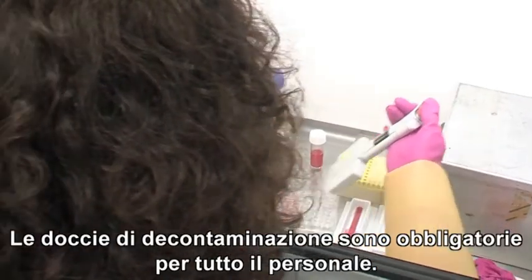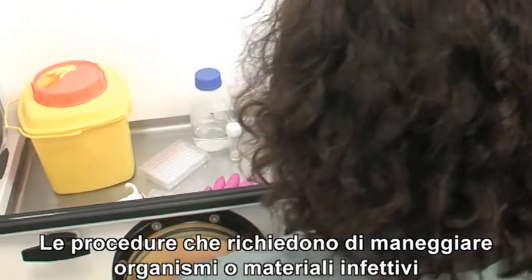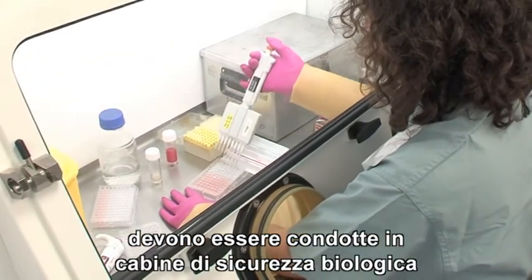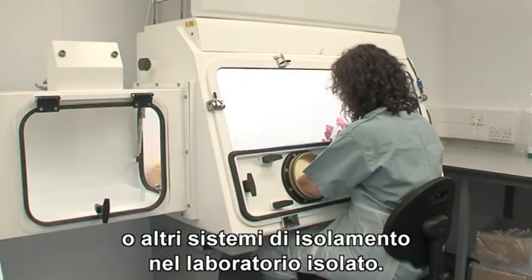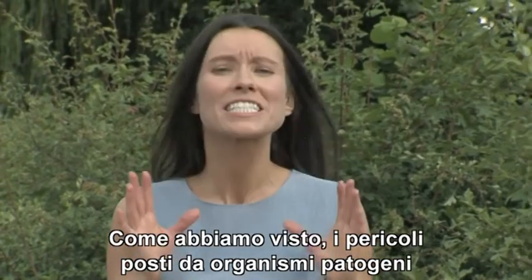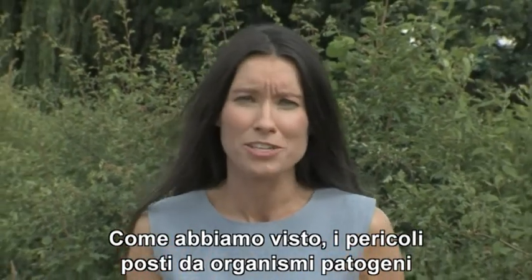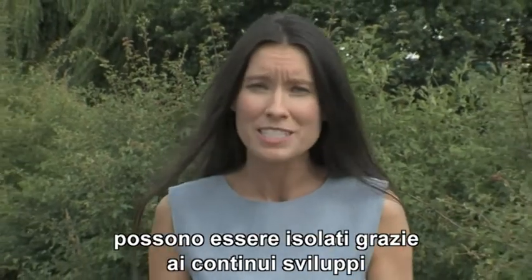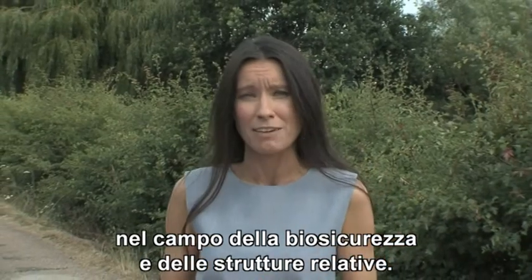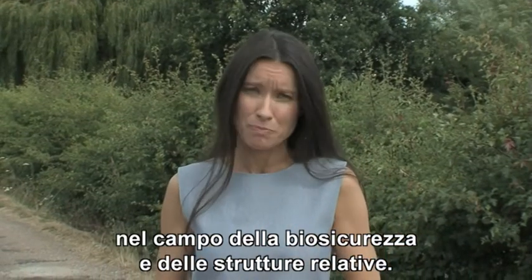At this level, all of the procedures that involve the handling of infectious organisms or materials must be conducted in biological safety cabinets or other physical containment devices within the contained laboratory. As we've seen, the dangers posed by many pathogenic organisms can be contained thanks to the continuing developments in the area of biosafety and the facilities to provide them.